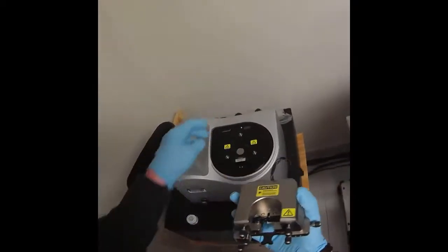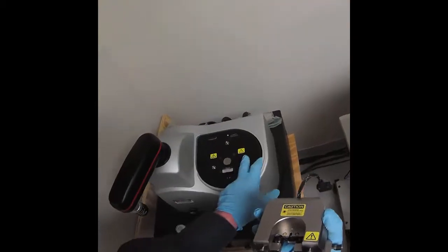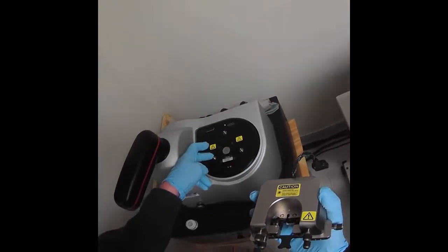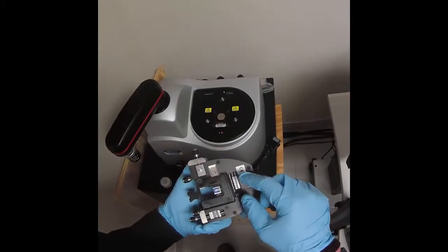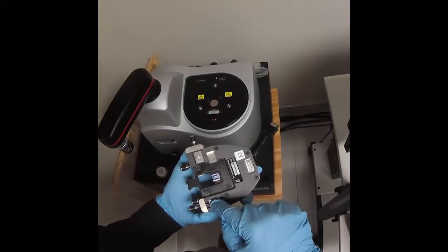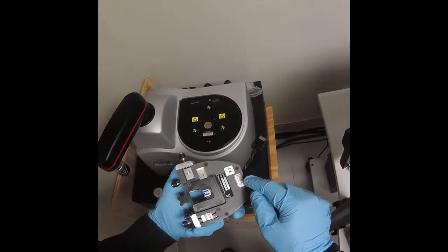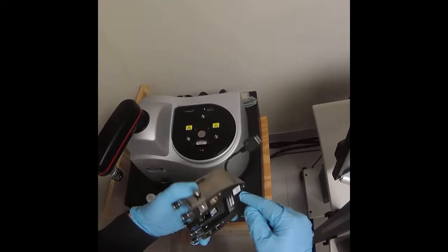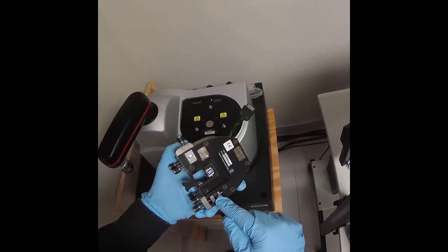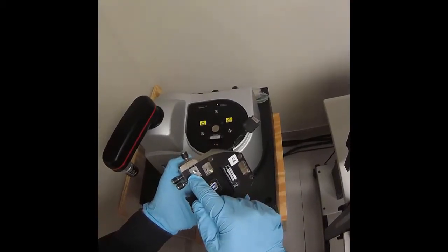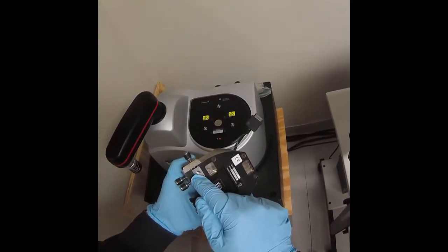The scan head is going to rest on these three beads on top of the micromotors. You see there's three indentations on the scanner head. This is the largest one in the back, so I start with that. Then I go to this one, which is the second largest, and I end up on this one, which is the smallest, and it'll just fit and lock in place.